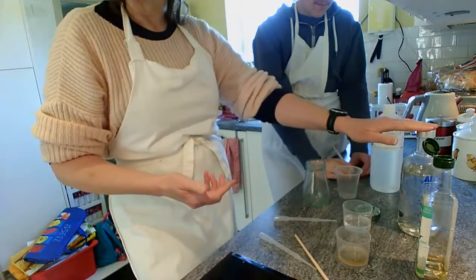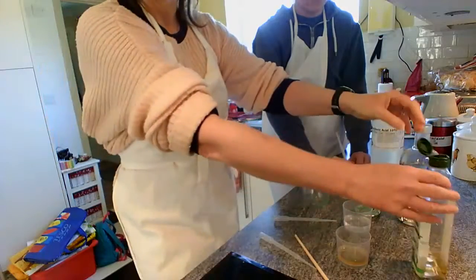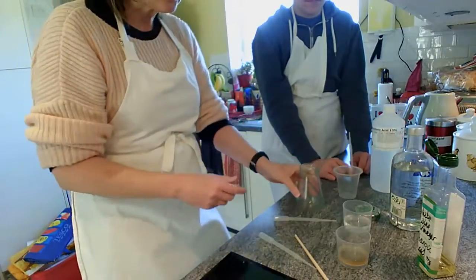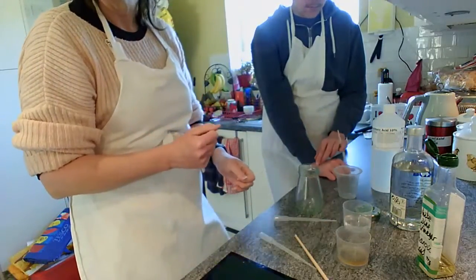Okay, so we're wearing glasses over our eyes because we've got hydrochloric acid today. Obviously, the alcohol, which we bought from the supermarket shelf earlier, and the vinegar, which was also bought from the supermarket, are not a problem. The ester that we're going to make, ethyl ethanoate, is also something that you will regularly come across in the supermarket. You will recognize the smell when we make it.